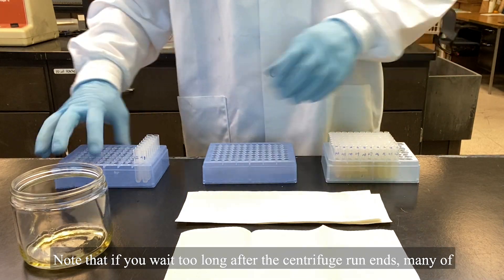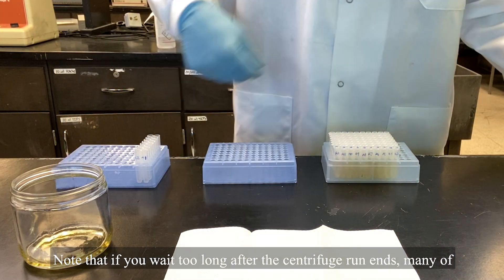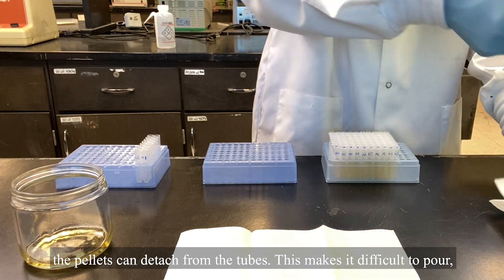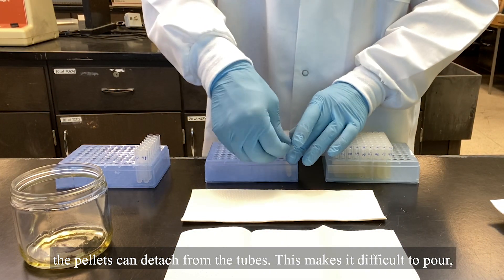Note that if you wait too long after the centrifuge run ends, many of the pellets can detach from the tubes. This makes it difficult to pour, so be relatively prompt about this step.